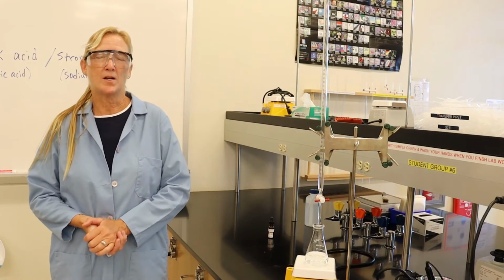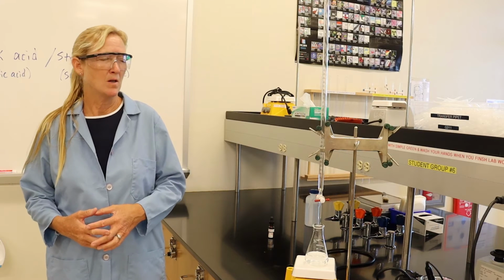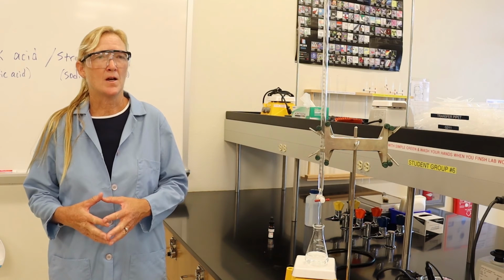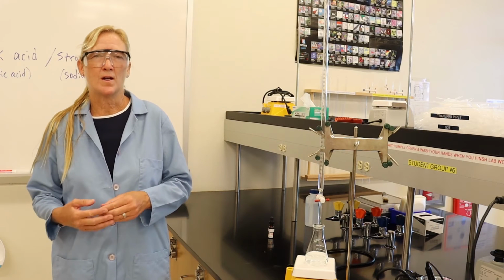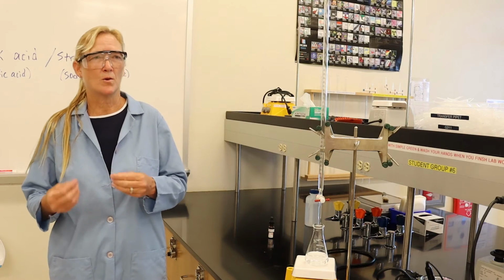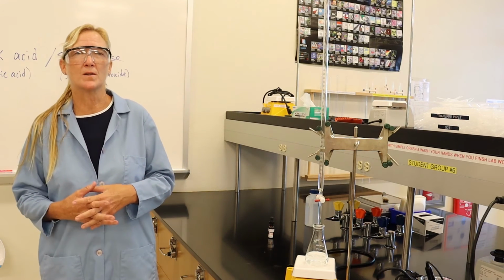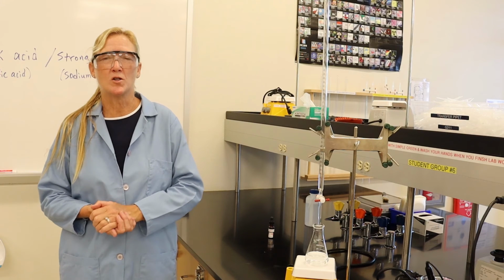So today we titrated a weak acid with a strong base. Acetic acid was titrated with sodium hydroxide. We used 0.1 molar acetic acid. We started with 25 mils, and we added 0.1 molar sodium hydroxide in increments of a milliliter, and as we got close to the equivalence point, I slowed it down to about a half a milliliter. I knew about where the equivalence point was because I did the calculations pre-recording of this titration.